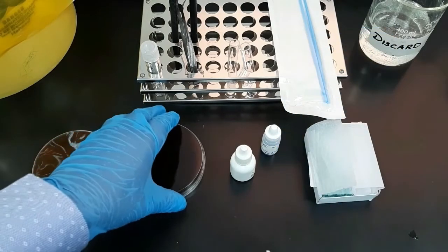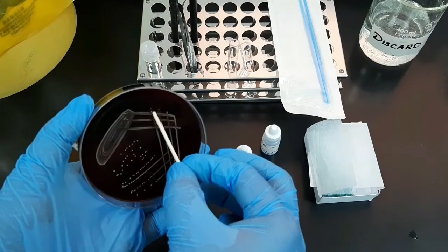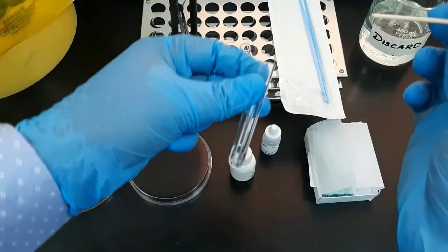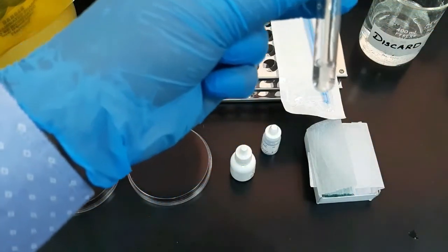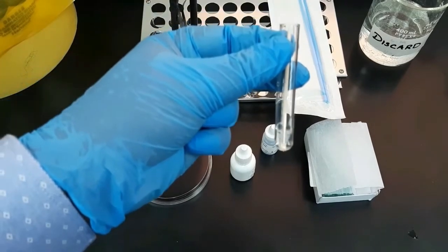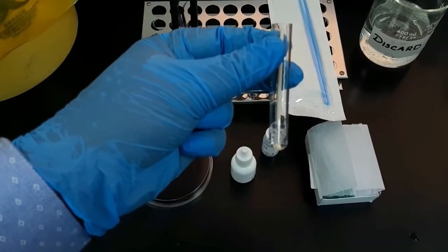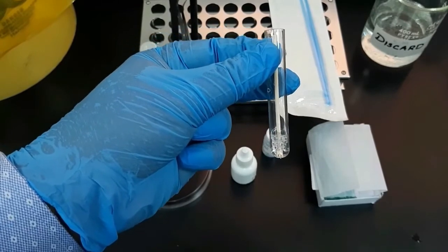Using a sterile wooden stick, pick up the colony from one plate and dip it into the test tube containing 3% hydrogen peroxide. The immediate appearance of bubbles upon first contact shows a positive result.